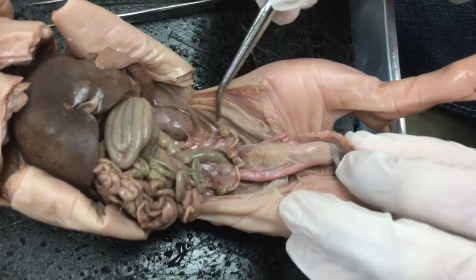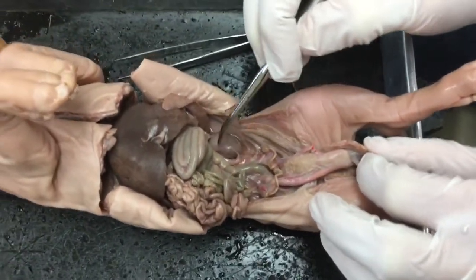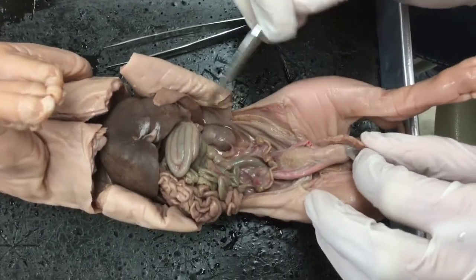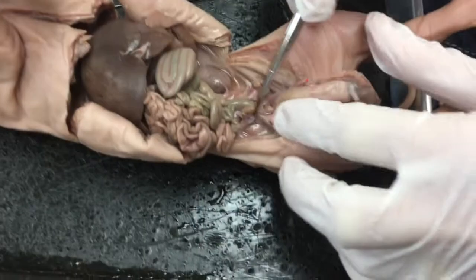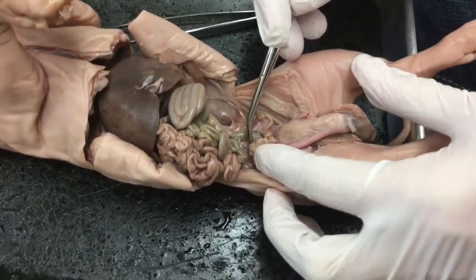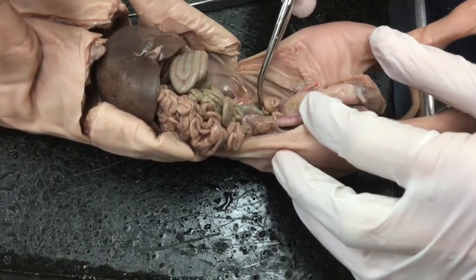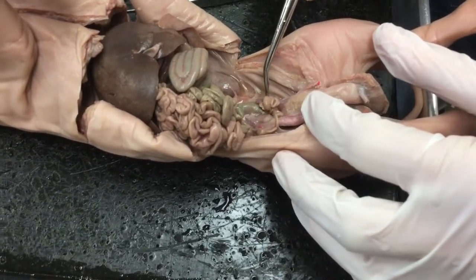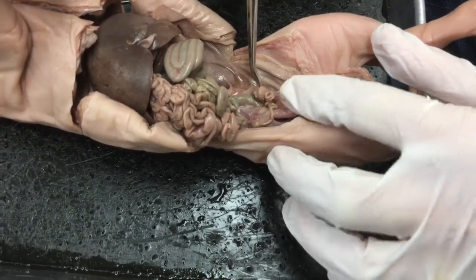arteries. Now, another part of the urogenital system, notice it's called urogenital because uro referring to urine production, genital referring to reproductive. So let's move on to some reproductive organs. So this little bean structure that we see here, that's an ovary, and we have another structure here, that's the other ovary. If I hold the ovaries up, let me see if I can do that.